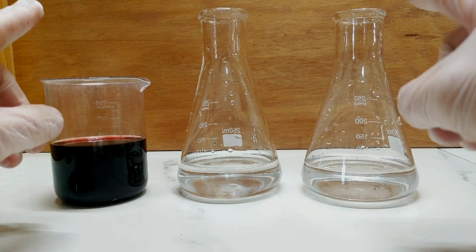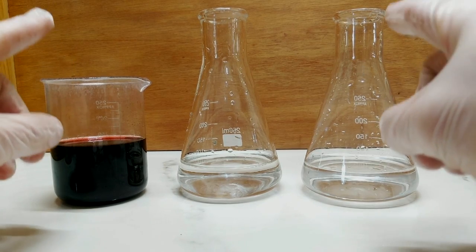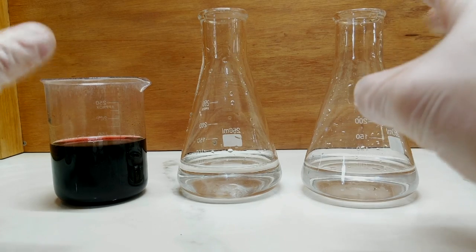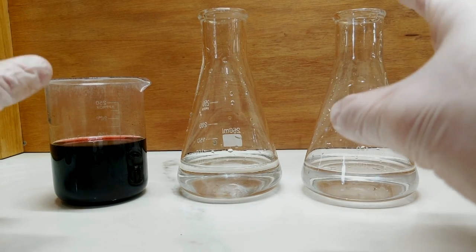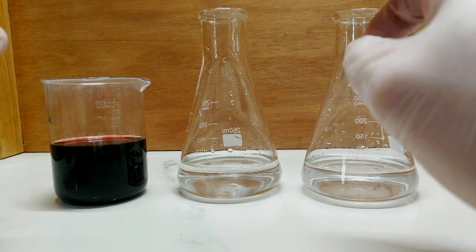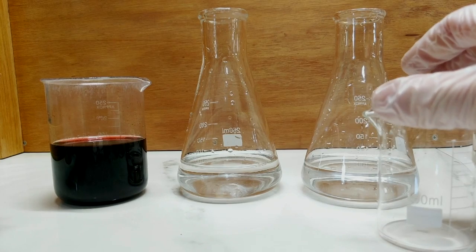I've only sort of played around with this slightly at the moment, so I'm not super confident on exactly what I'm doing. But I've managed to produce a few little samples of pigments. I thought I would try and make a slightly larger more controlled sample this time.